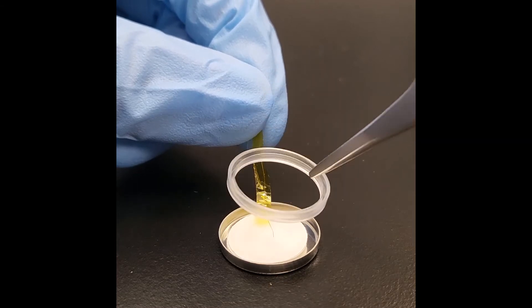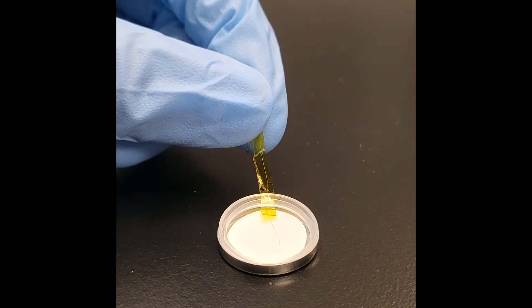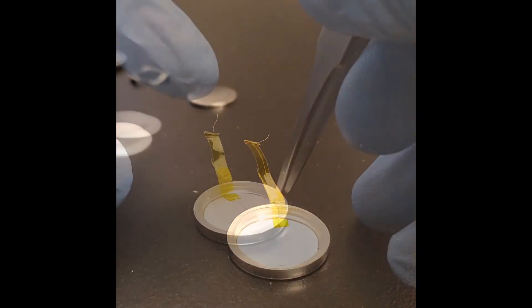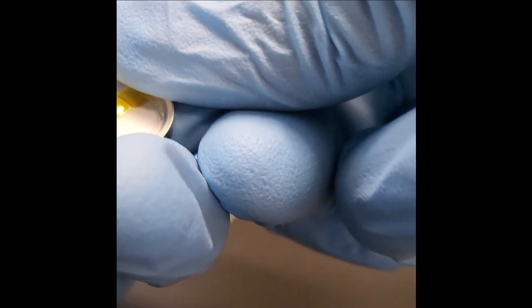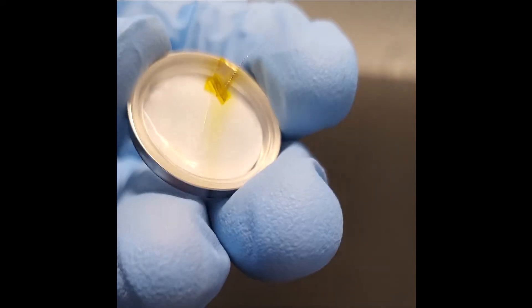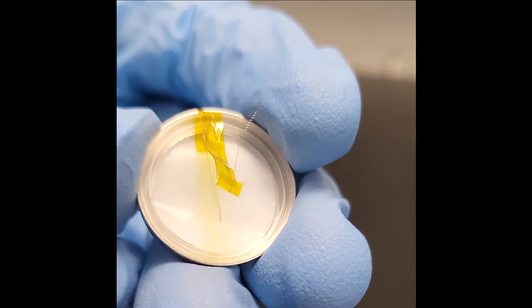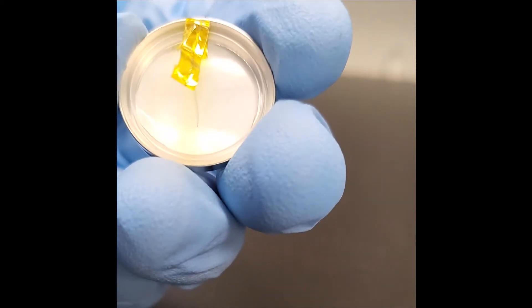Keep in mind that we are trying to prevent the wire from touching the positive cap below. After positioning the wire, insert the gasket and press to keep it in place. Now we want to prevent the wire from moving around. To do that, try to make a fold on the wire right at the edge of the gasket. Ideally, the inside segment of the wire, the insulated part above, and the outside segment of the wire should all be aligned with each other. This doesn't have to be perfect, but the placement is going to be more stable if it is aligned better.